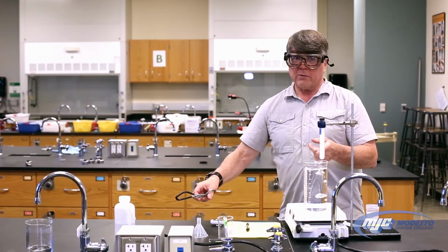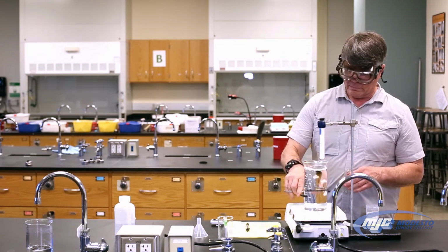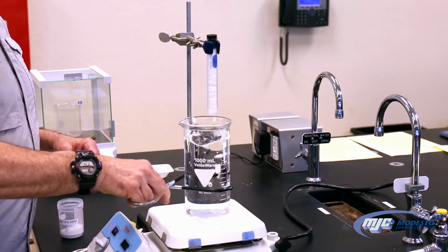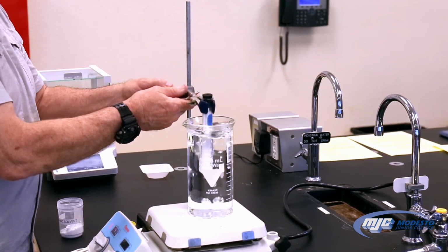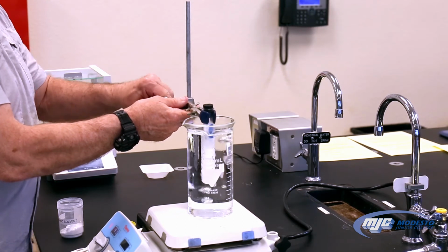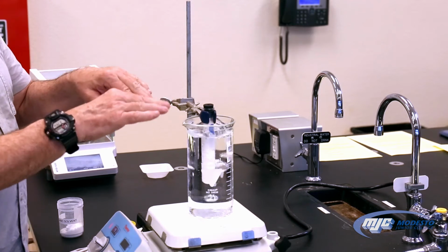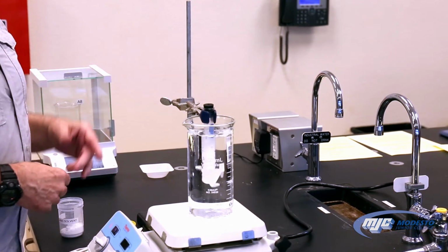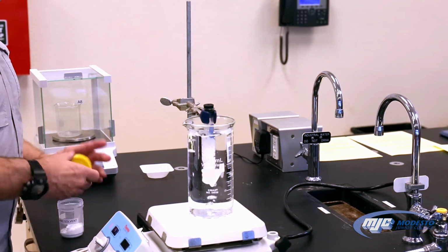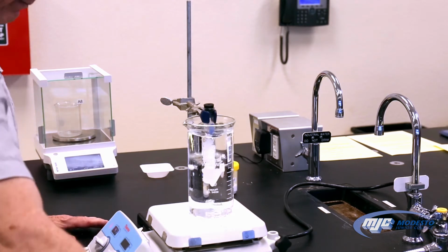Now, this is hot, so if I have to move it, I'm not going to touch it with my hands. I use some beaker tongs, and that's what it's for. Just move it around. Submerge it as much as I can. It doesn't matter, guys, that it's not all the way submerged. There's a little bit of lauric acid on top, because you'll see as it melts, it's going to shrink down. Okay, so once that has finished melting, we're going to take it out.